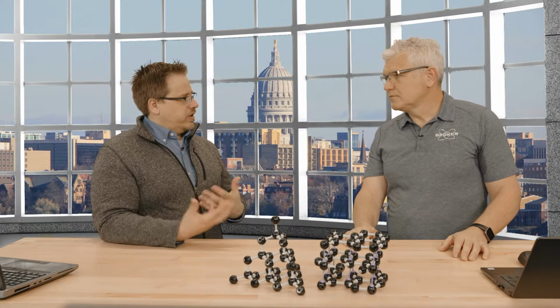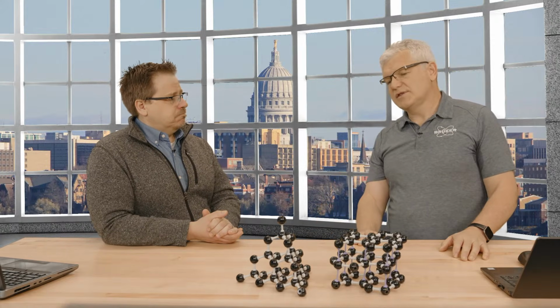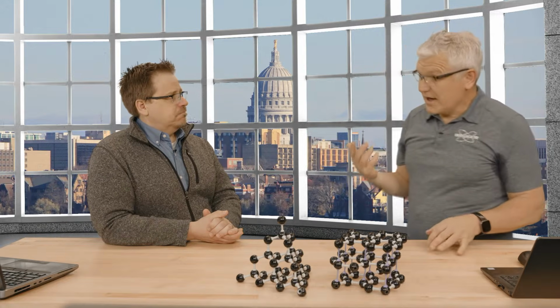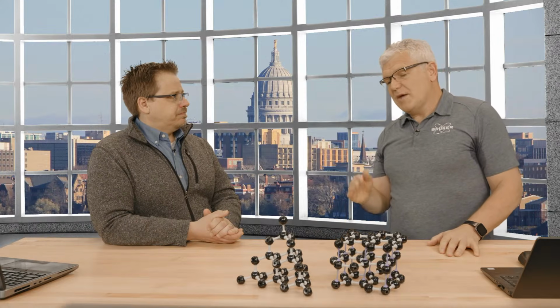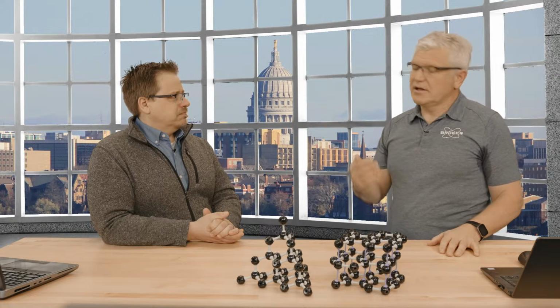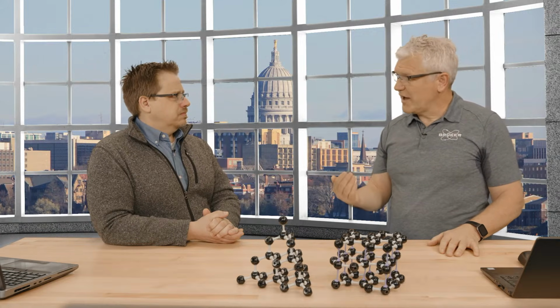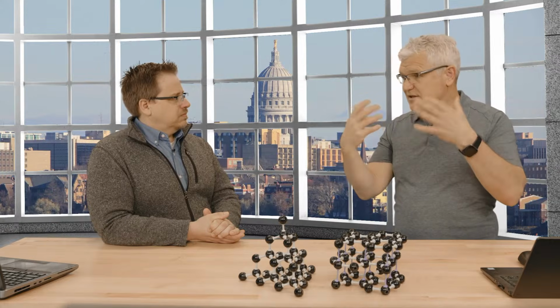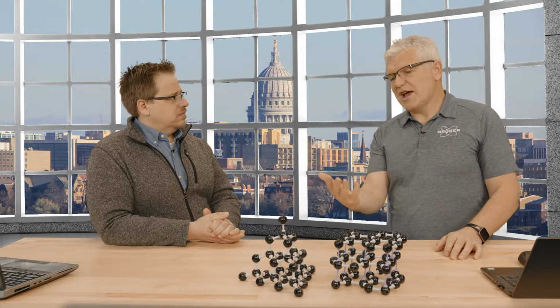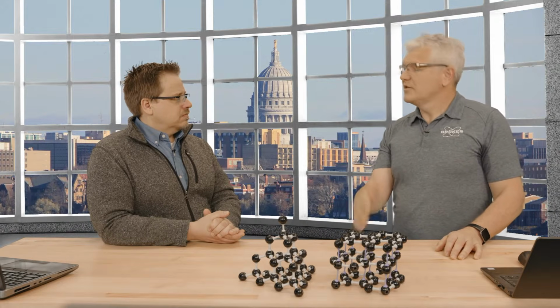So how does having a twin affect the diffraction experiment? If you have very high symmetry, then very often when you look at the X-ray experiment, and the X-ray experiment is just the Fourier transform of the electron density of the structure itself, the symmetry is then maintained in the diffraction pattern. So you will get this additional symmetry introduced by twinning. You will also have that in the diffraction pattern. If you have high symmetry, then very often the spots are completely overlapped. So determining the unit cell, the smallest unit that repeats itself over and over, will be simple. But because you have an overlap of the reflections, the intensity of the reflections that we need to determine the structure will not be right anymore.